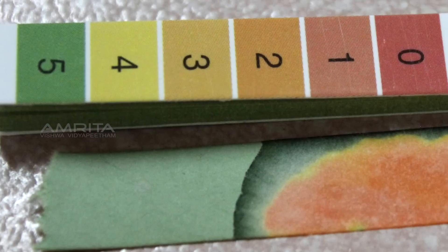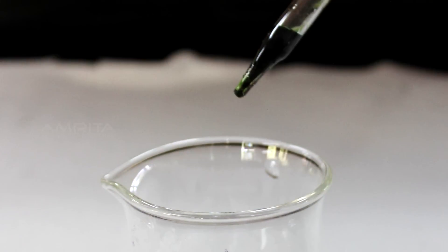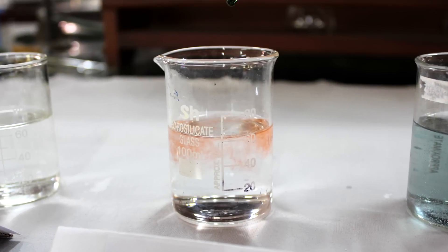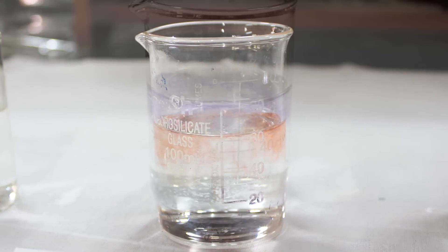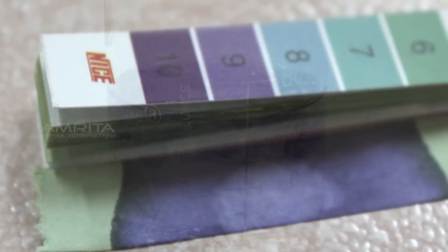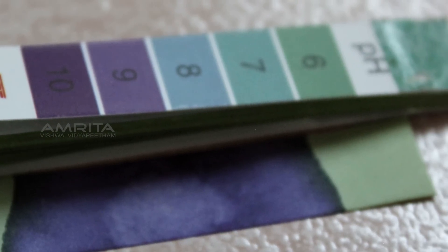Through these methods, we can determine the pH value of 0.1 molar HCl and pH value of sodium bicarbonate. The pH value of 0.1 molar HCl is 1 and that of sodium bicarbonate is 9.